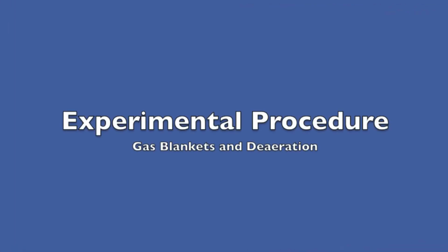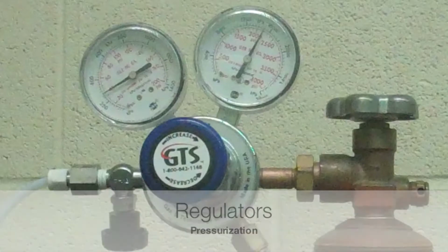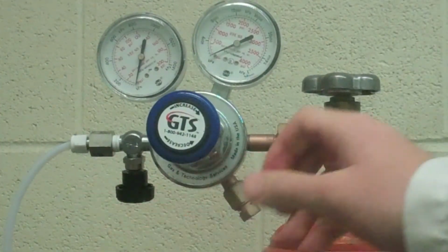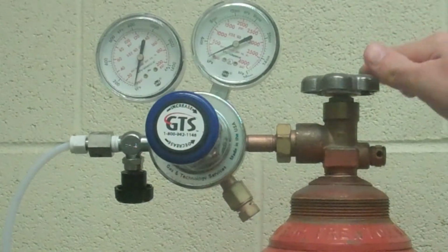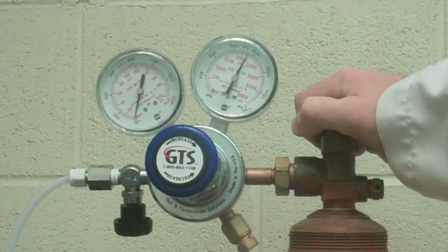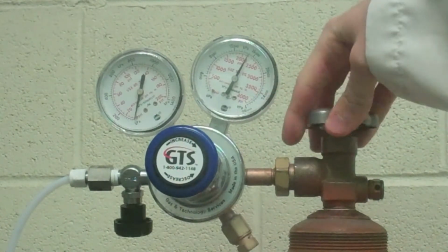Experimental procedure, gas blankets, and deaeration. Make sure the needle valve is closed, the regulator spring is not engaged, and the cylinder valve is closed. Both gauges should be zeroed. Open the cylinder valve until the high pressure gauge is steady. The valve should be opened completely.